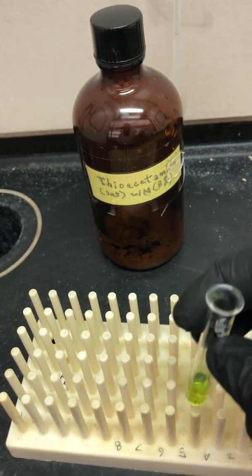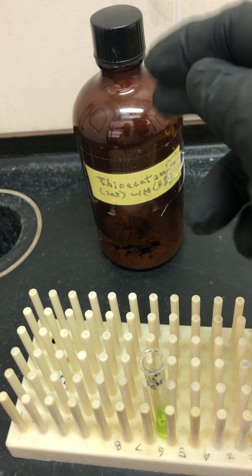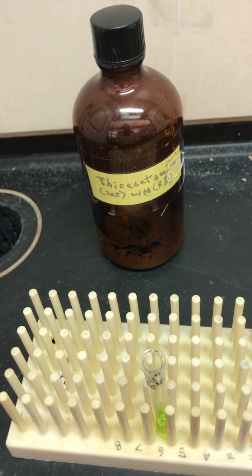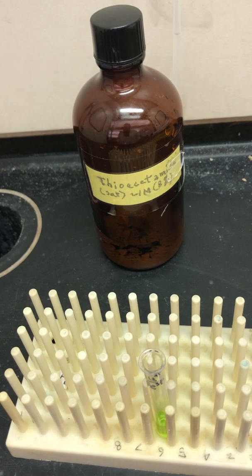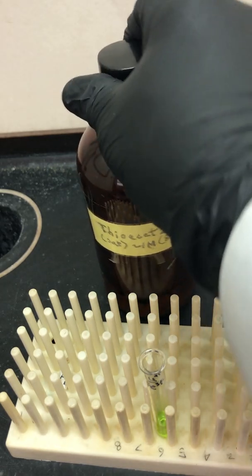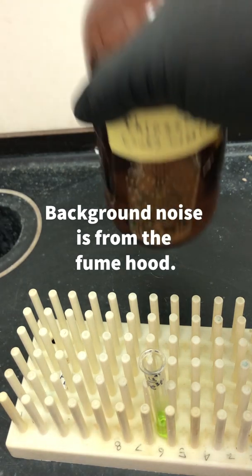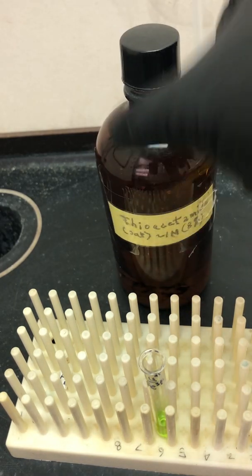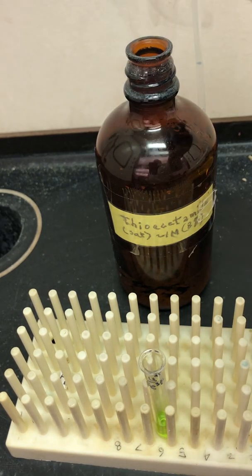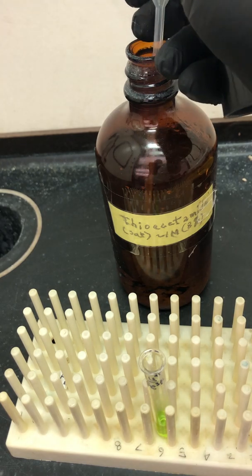What we're going to do is precipitate them as sulfides. We're going to feed the sulfide from a solution of a chemical called thioacetamide. By the way, any time that you work with sulfides, they smell very strongly, so we do this part here in the fume hood. I'm going to open my bottle of thioacetamide — again, I'm in the fume hood. Never let the lid touch the bench, so I'm going to hold it between my finger and my palm.